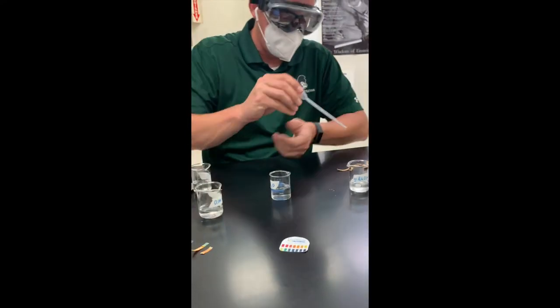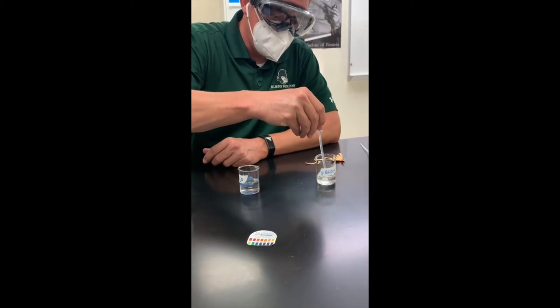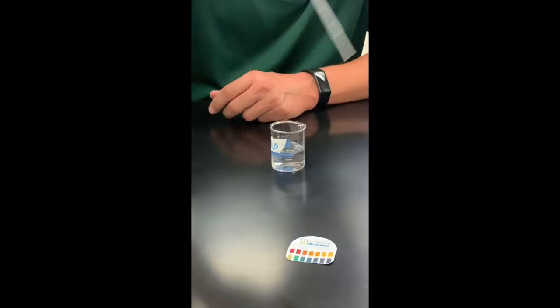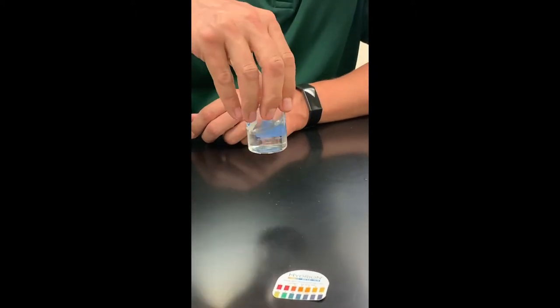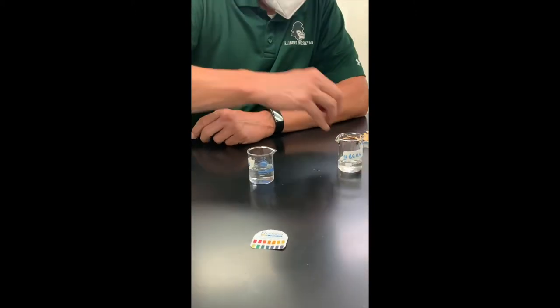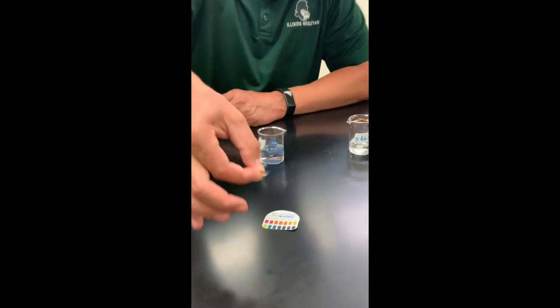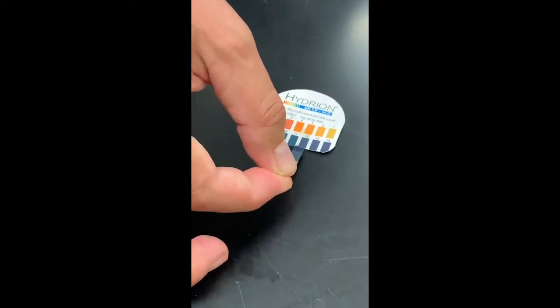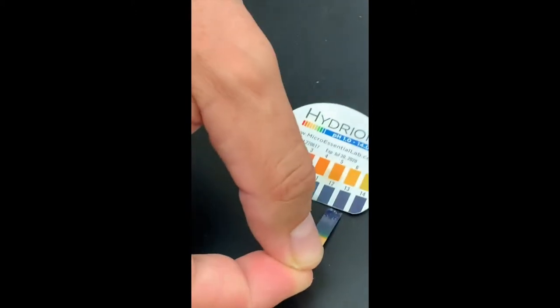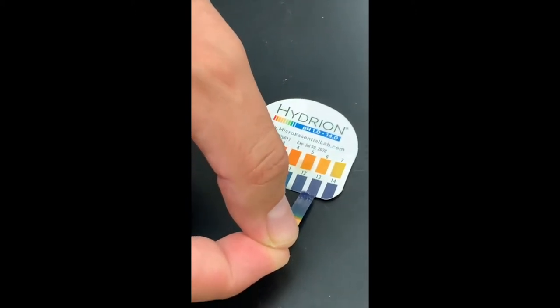We're going to take a third milliliter of 0.1 molar NaOH, add it, swirl, and take the pH with some pH paper again. And this appears to be sitting at around 13.